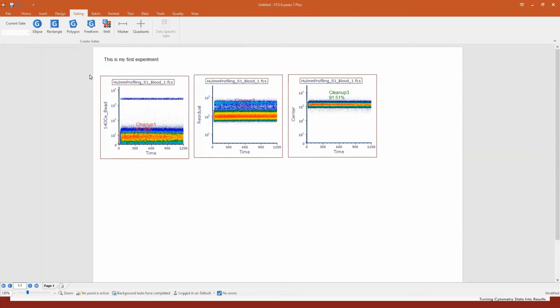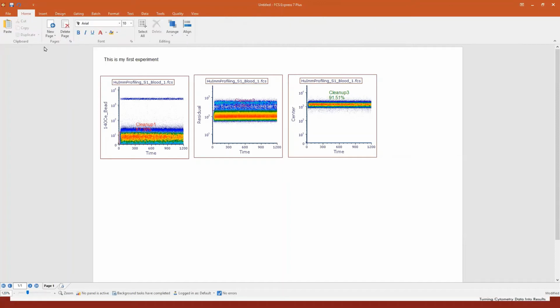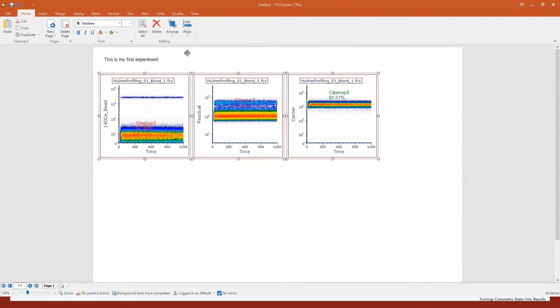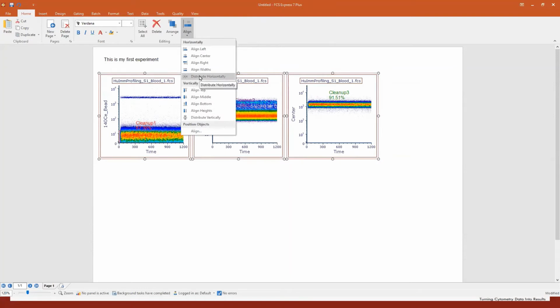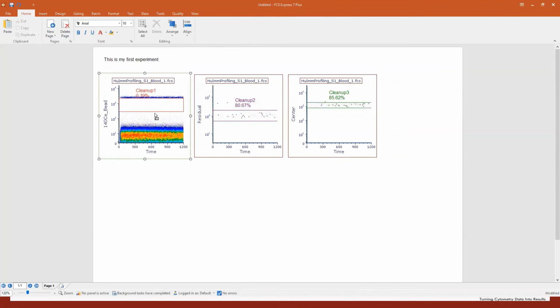If you want to change the page setup, if you want to insert a new object, you see here in the home tab, I can select my plots and say align them to the top. Arrange them, like distributing objects horizontally so that they are equally spaced. Everything is laid down on my page as I want with live updating capability. You see, I can change the position of my gates and everything is updating live. This is not only true for 3 plots and 1 page. Remember, I was dealing with a 15 pages layout with a lot of files.